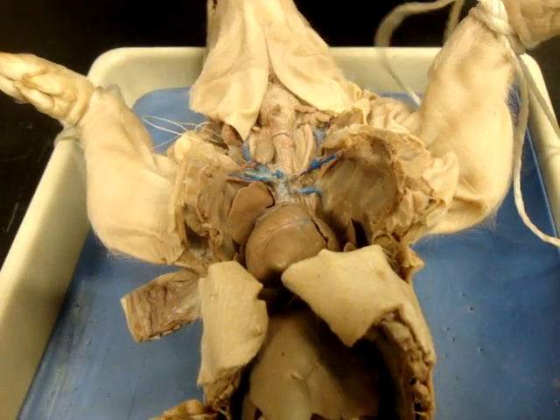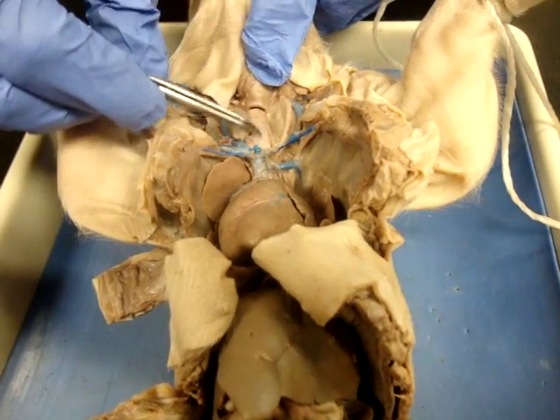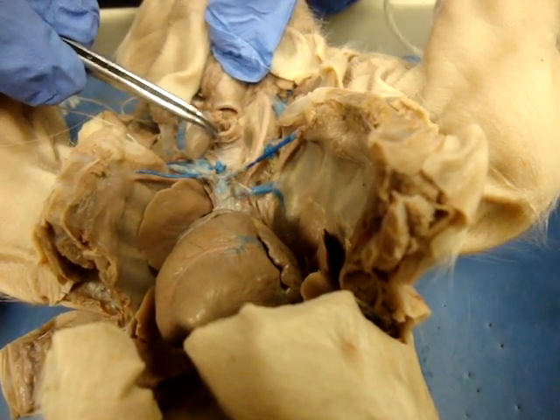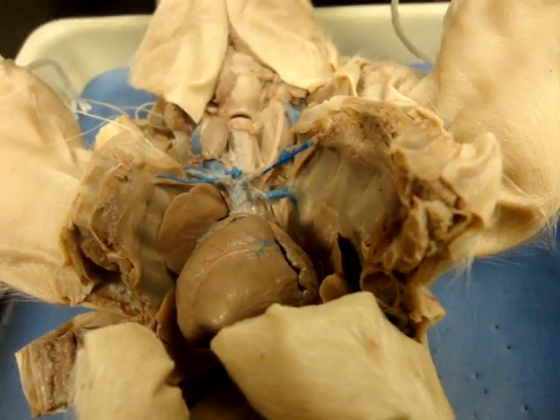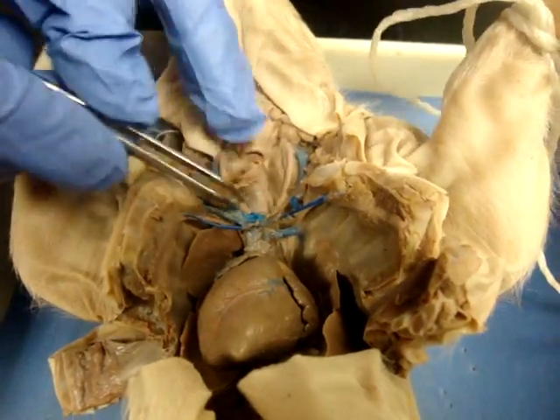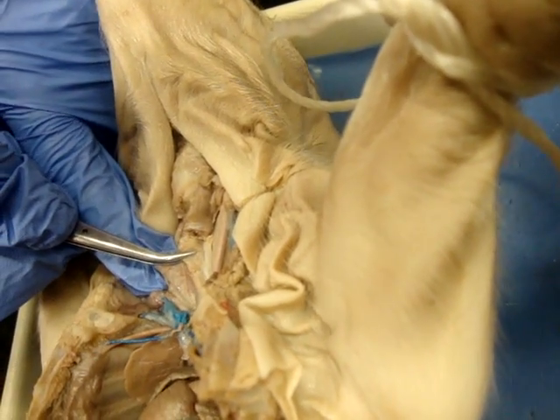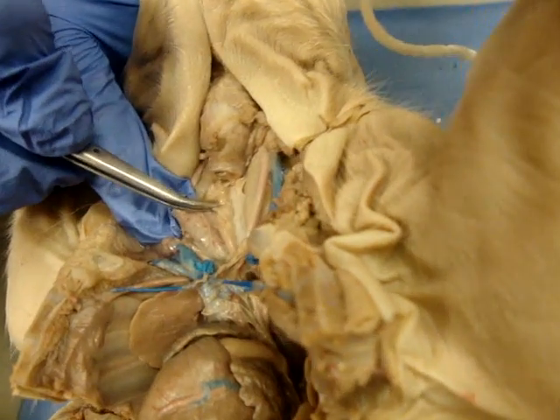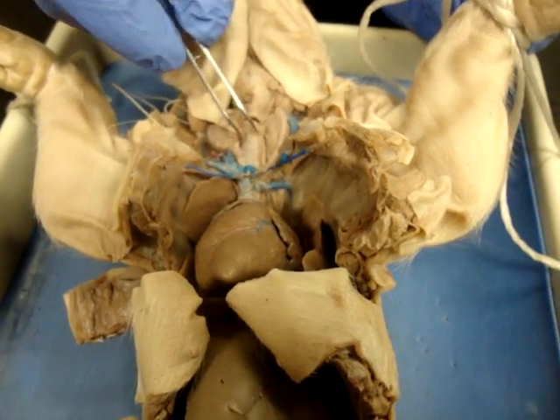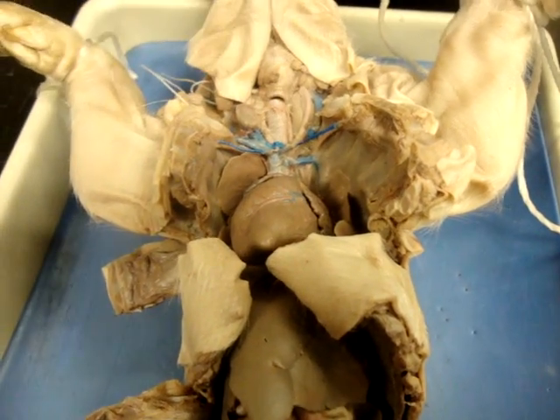From there, the trachea is down here. The way you tell your trachea is that it has these rings that surround it, and that's going to help to keep it nice and open. So this is held open even though the animal is dead. If we go back behind this, we find the esophagus. Here's your esophagus — as soon as you're able to find that trachea, right behind it is going to be your esophagus. Same thing with humans: our esophagus is a muscular tube located back behind our trachea, and the trachea helps to protect it.